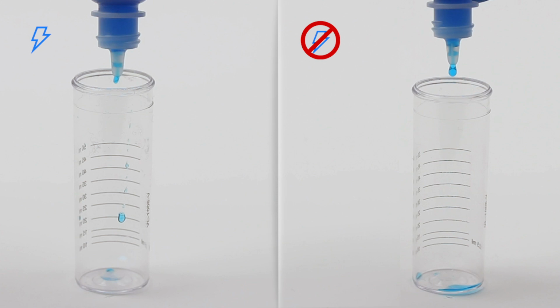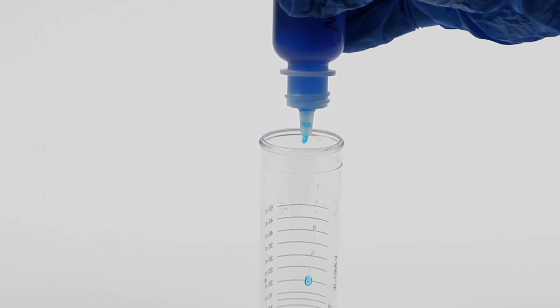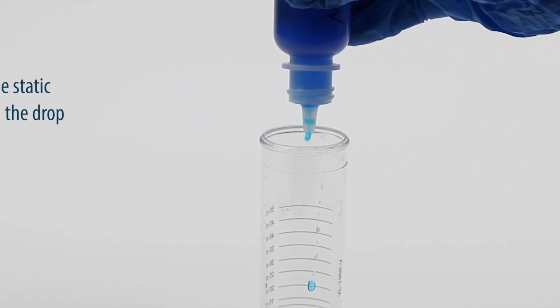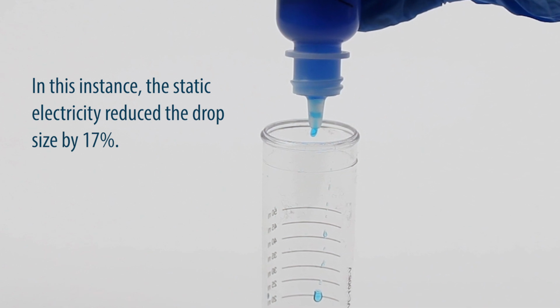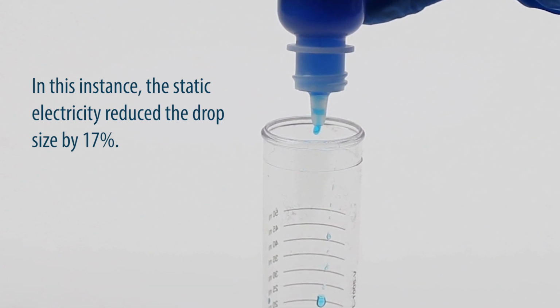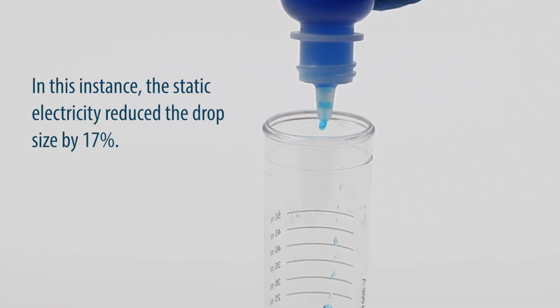Drop count test kits and dropper tips are calibrated to a specific drop size. Static charges can affect this drop size, which will cause an error in your results. In this instance, the static electricity considerably reduced the drop size, leading to a 17% error in your results. Other levels of static may give different results.